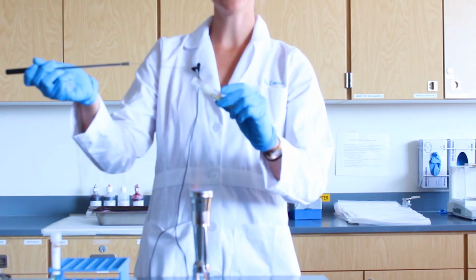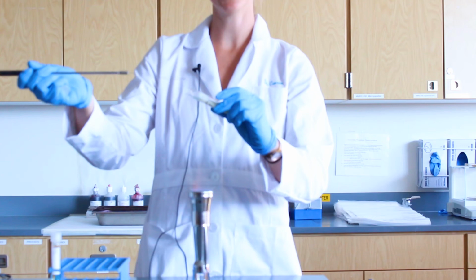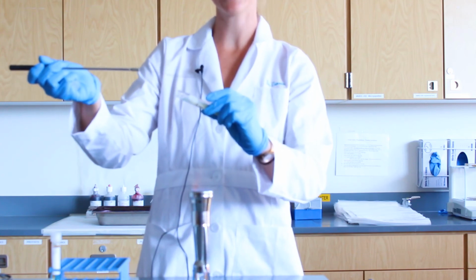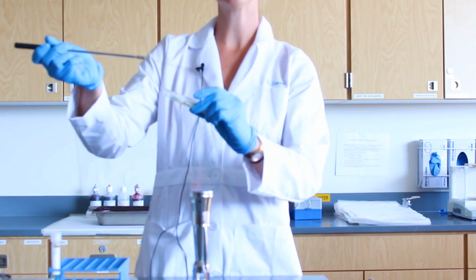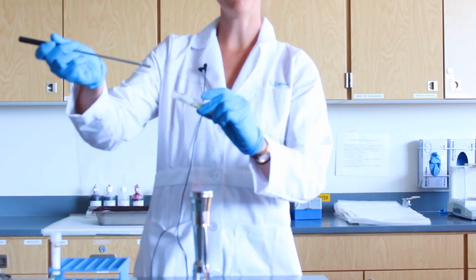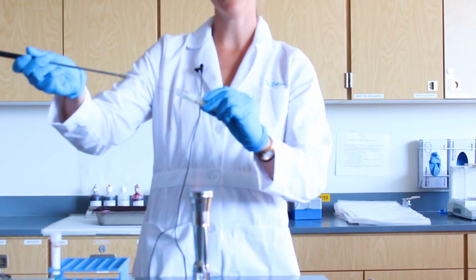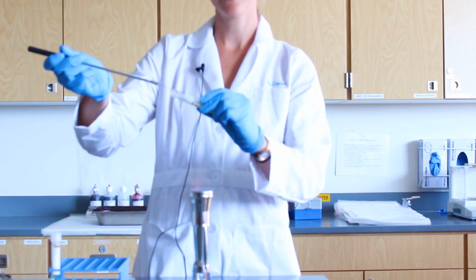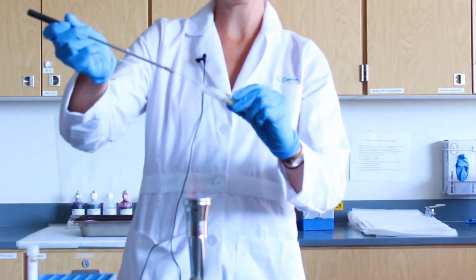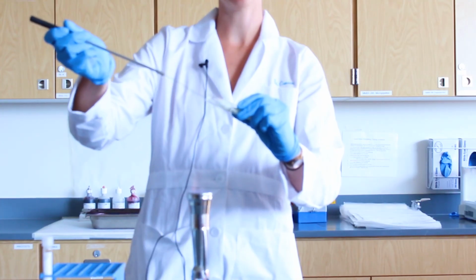When inoculating an agar slant, you will want to move your loop up in a fishtail wave-like motion up the slant. This will make it so that the bacteria is easily visible within the slant. When doing so, make sure you do not press too hard into the agar as to penetrate it. You will only be moving right above the agar surface, again in a fishtail motion. So place your loop to the very bottom of the slant, and move in that fishtail motion up and down the agar slant, just gently touching the top of the agar.